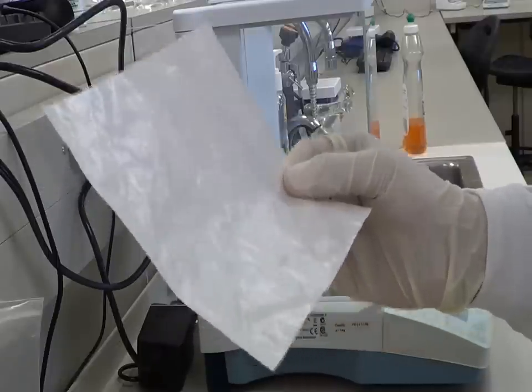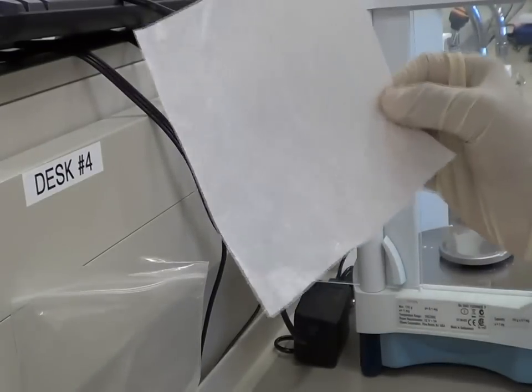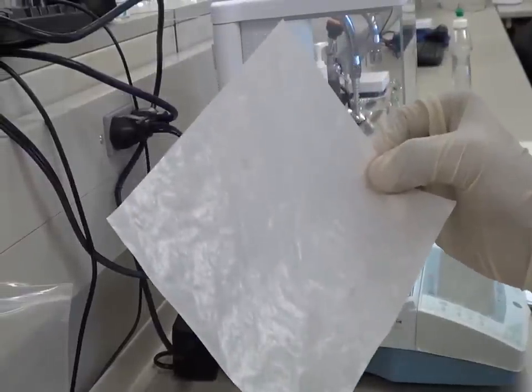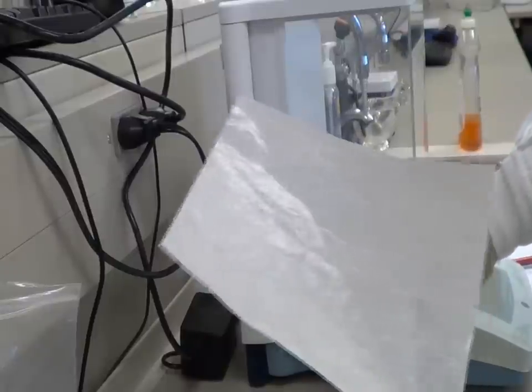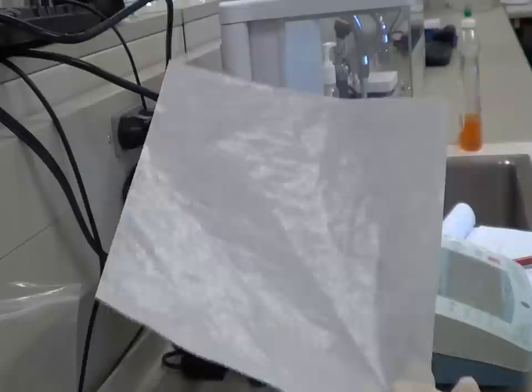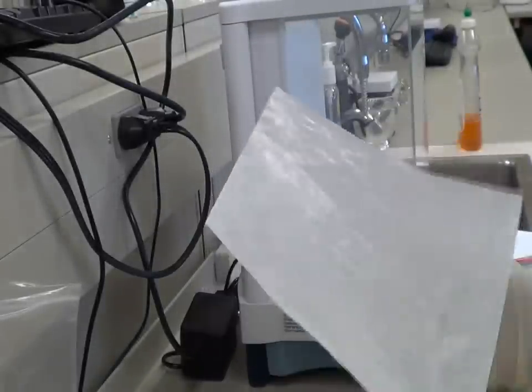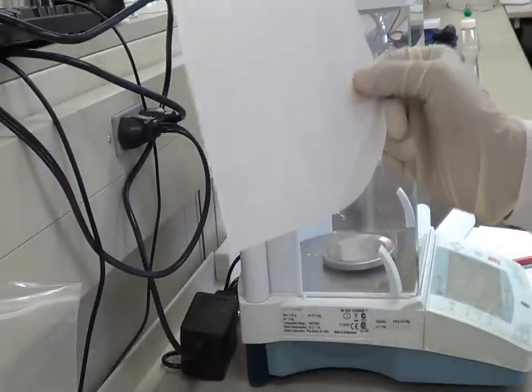And if you don't know it, watch it carefully because you are going to prepare the weigh boat for weighing in the compounding pharmacy. In the extemporaneous preparations, you have to weigh your active ingredients all the time. So either you can buy your own weigh boat or you can make a paper weigh boat using these weighing papers which we have.